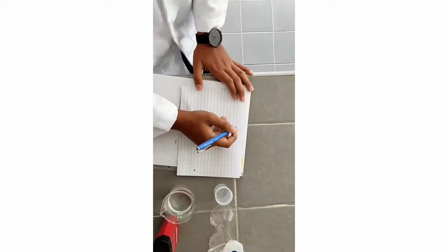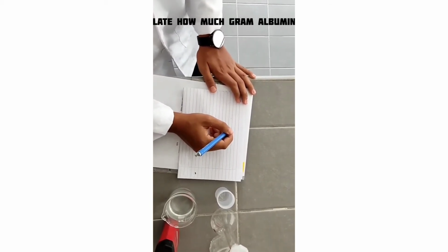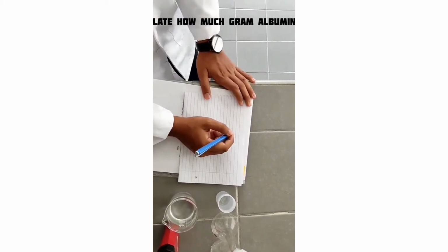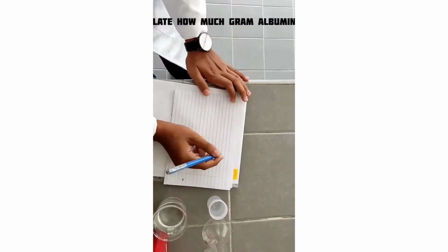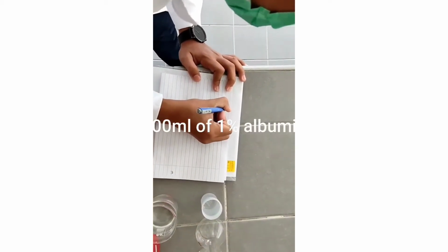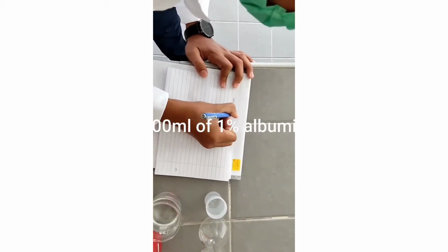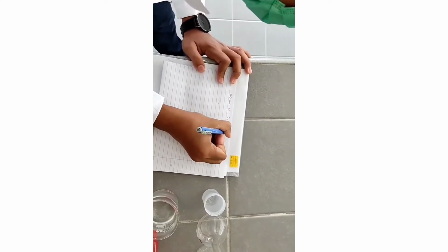Before we do the experiment, we must calculate how many grams of albumin we need for 100 ml of 1% albumin solution.